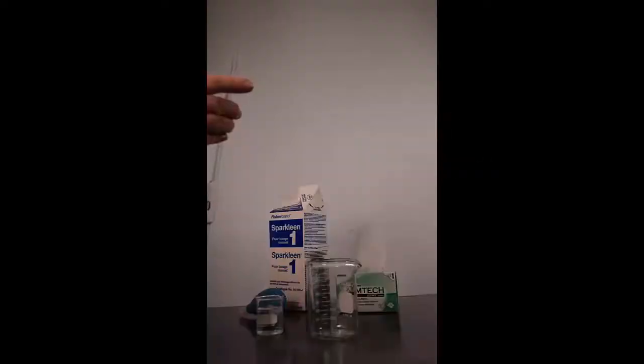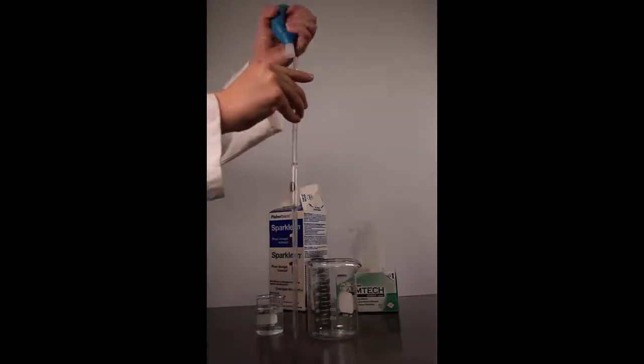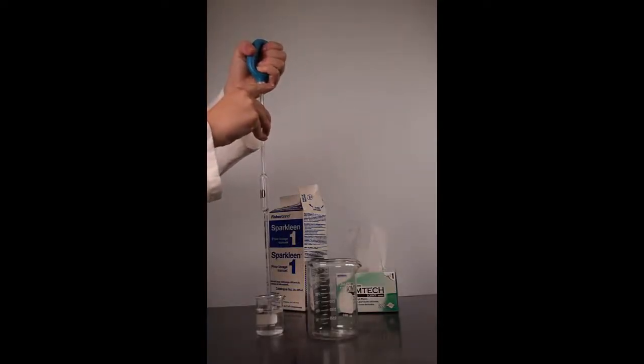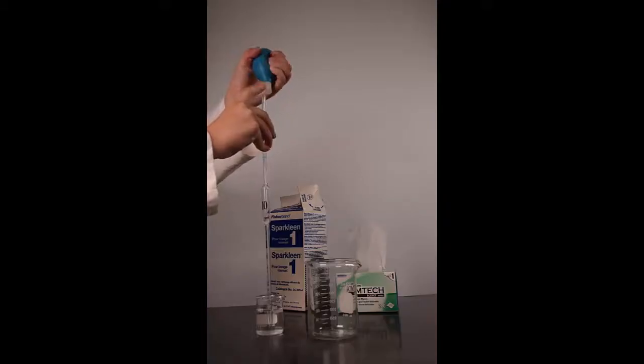Rinse the pipette with deionized water three times. To do this, fill the pipette to just above the bulge in the pipette. Remove the pipette bulb and seal the pipette with your index finger.